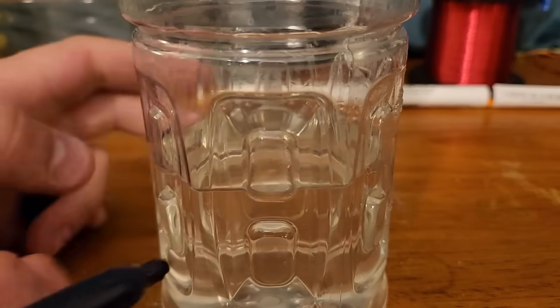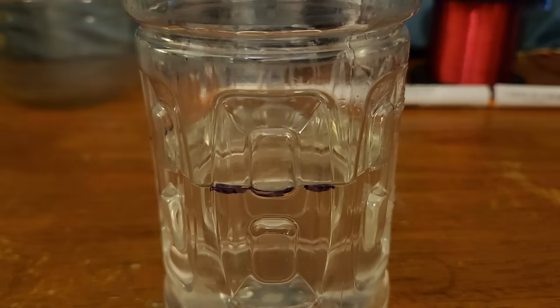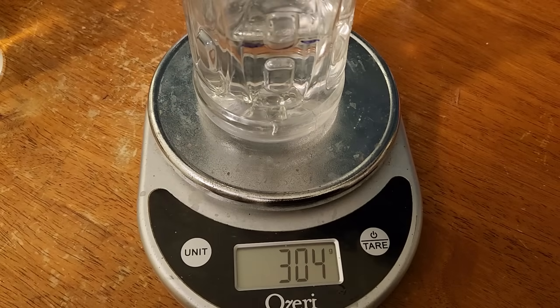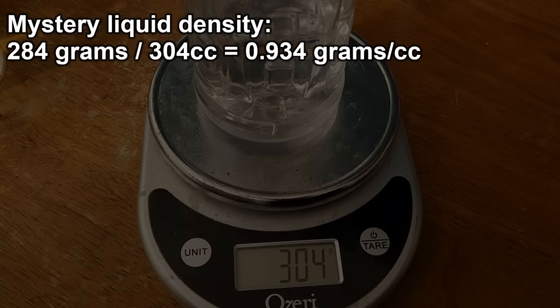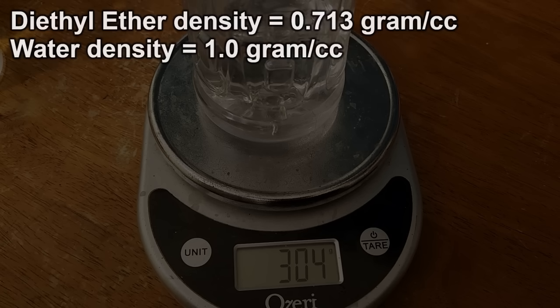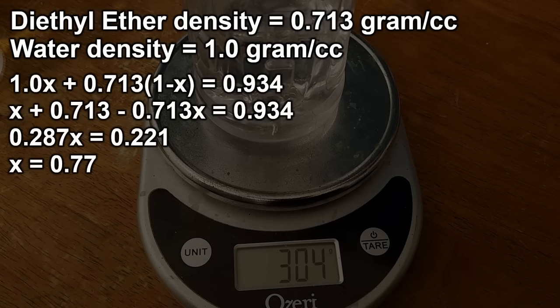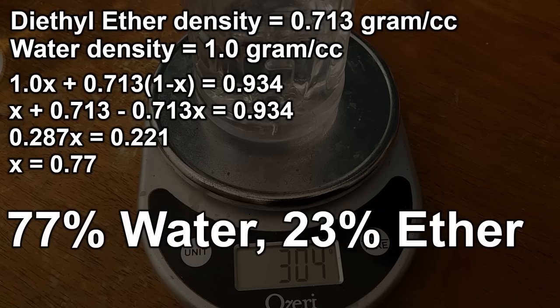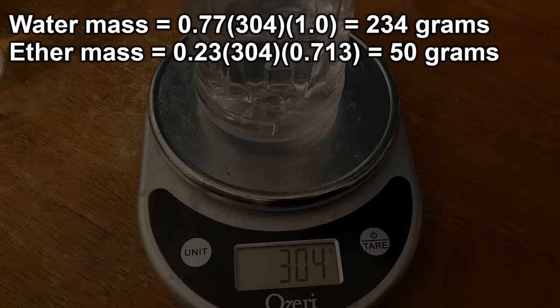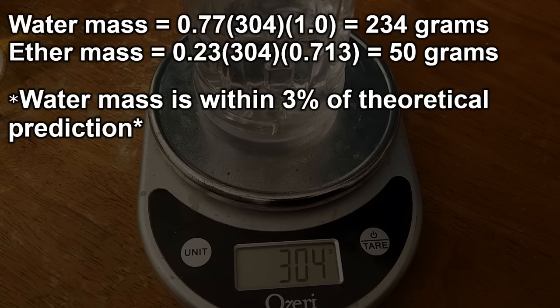Let's figure out what the density is. I don't have a hydrometer, but I can do a crude test by marking the water line on the collection bottle then figuring out what the mass of fresh water at the same level would be. With fresh water it's 304 grams, but our mystery liquid had 284. This means the average density is 0.934 grams per cc, noticeably less than the 1 gram per cc for pure water. Diethyl ether has a density of 0.713 grams per cc, so if we assume this is a mixture of only water and ether, that works out to 77% water by volume and 23% ether — 234 grams of water and 50 grams of diethyl ether. The water mass is pretty close to my theoretical prediction and the amount of ether accounts for most of the missing yield.